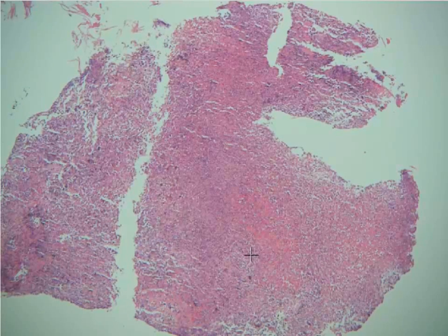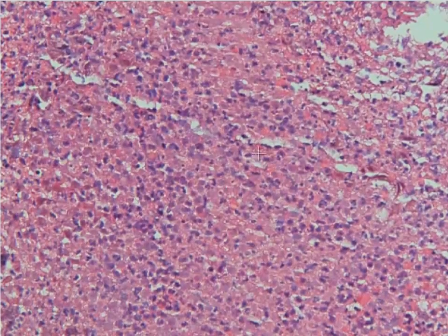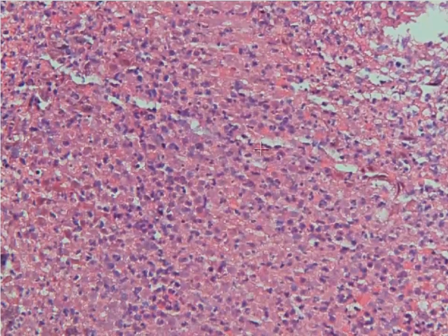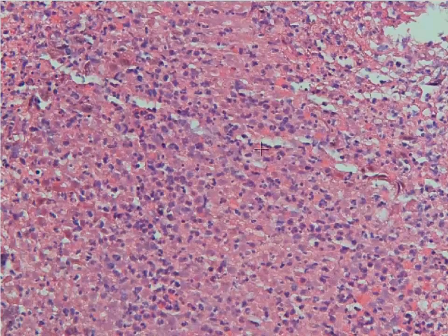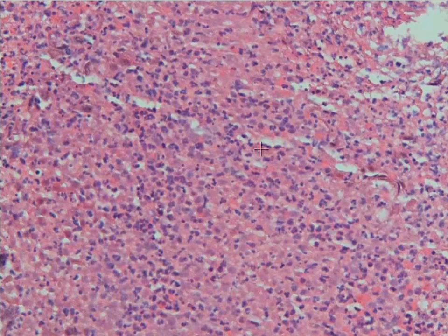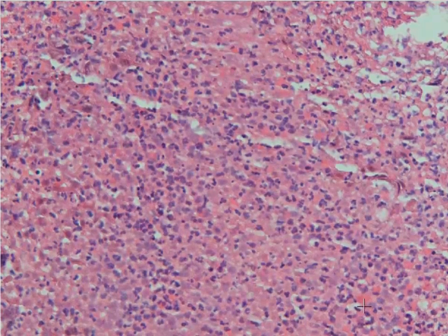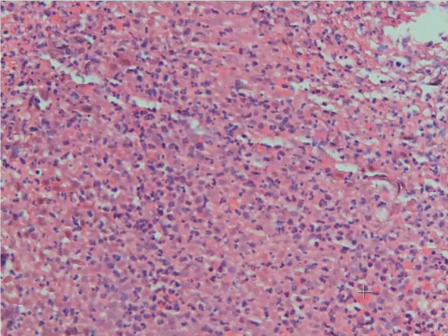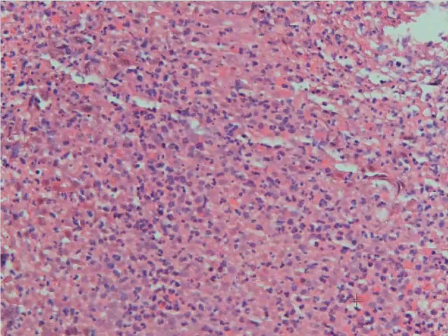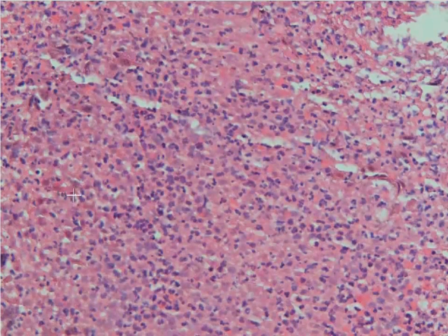So we're going to go to higher power and look at those cells. Here you can see that there are a lot of inflammatory cells scattered around, as well as necrotic keratinocytes. These are the necrotic keratinocytes, and you'll see they have undergone coagulative necrosis.